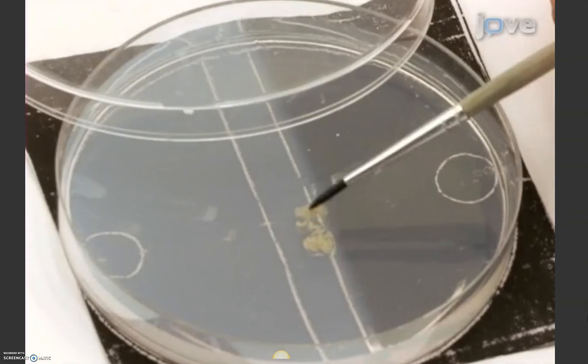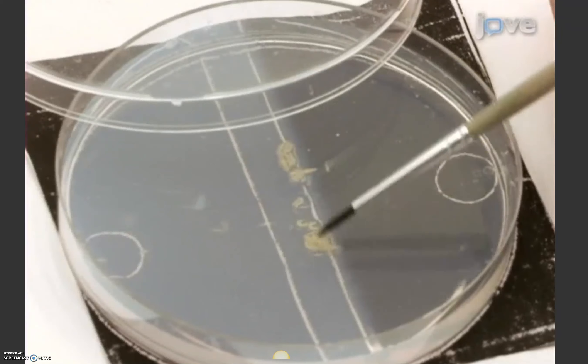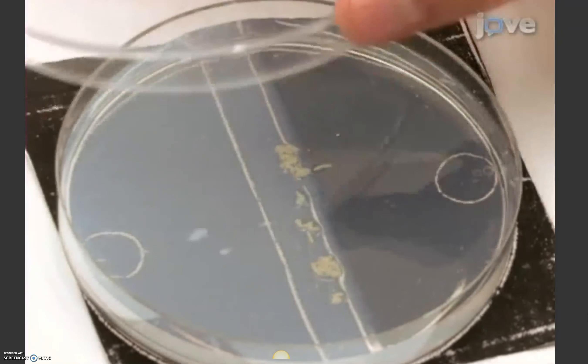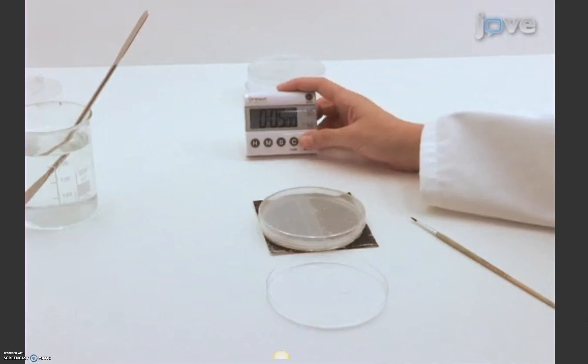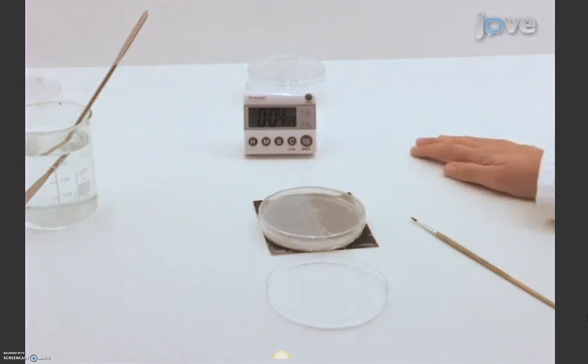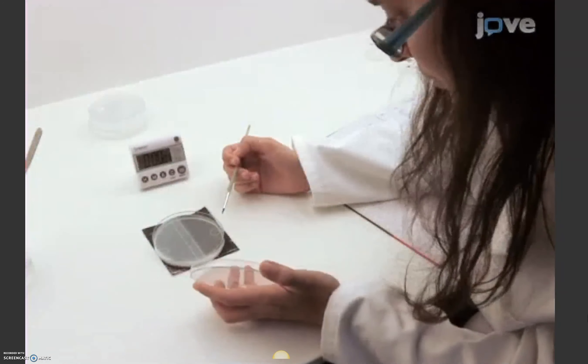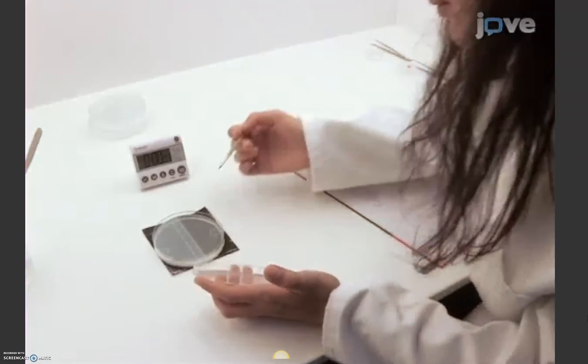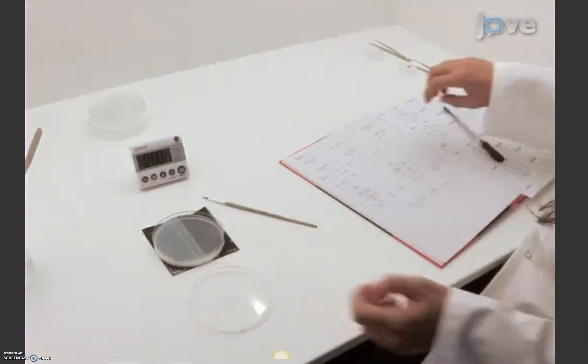With the half-half dish prepared and at room temperature, place 30 naive cleaned-off feeding third instar larvae at the centre of the dish. Close the lid and wait for 5 minutes. Subsequently, using the template, count the number of larvae on either side and count those in the middle.